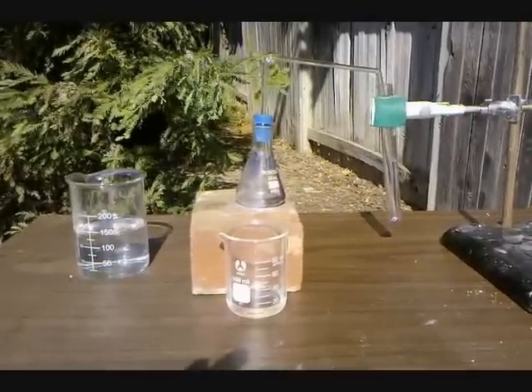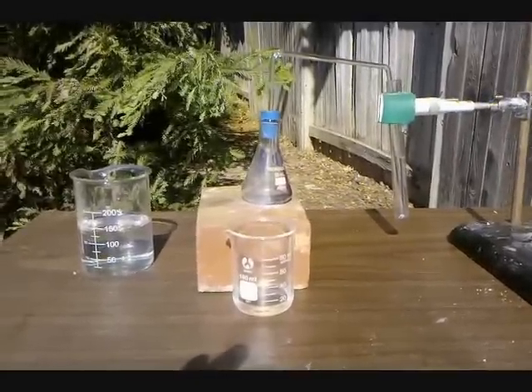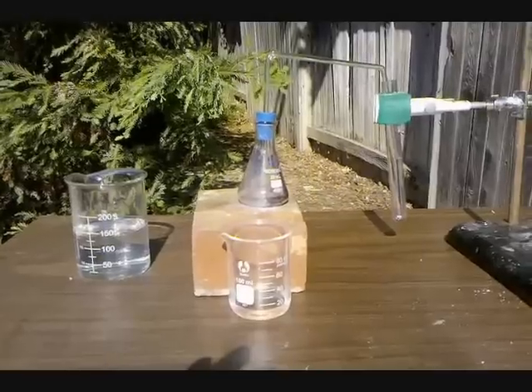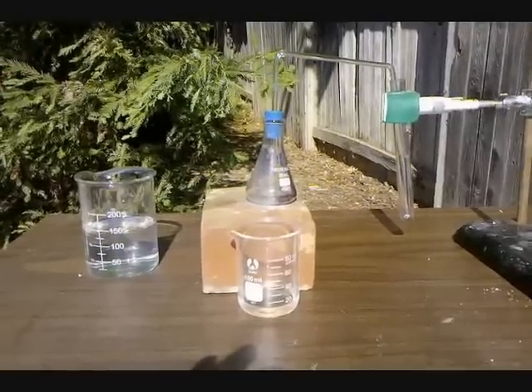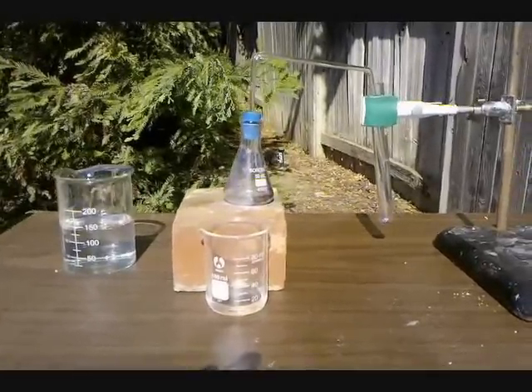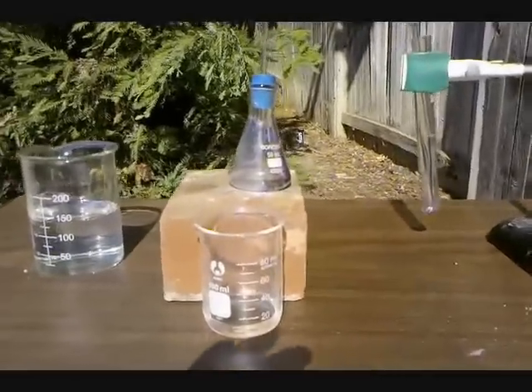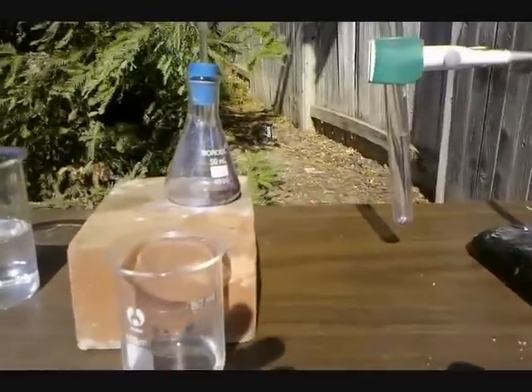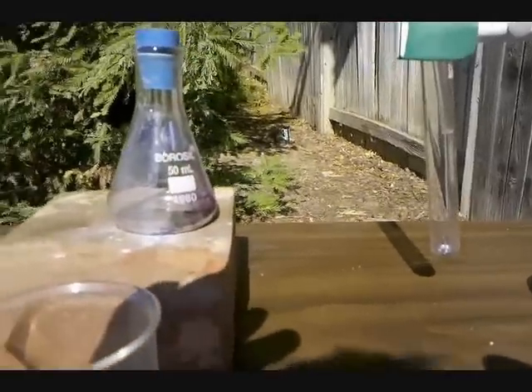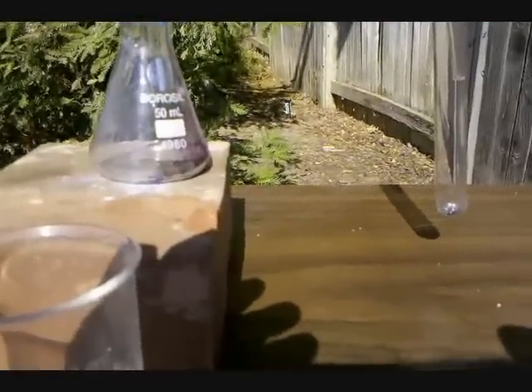Hey everyone, in this video I'm going to be synthesizing an interhalogen, which is a molecule consisting only of halogens. The molecule I'm synthesizing is iodine monochloride, which is one iodine bonded to one chlorine atom.